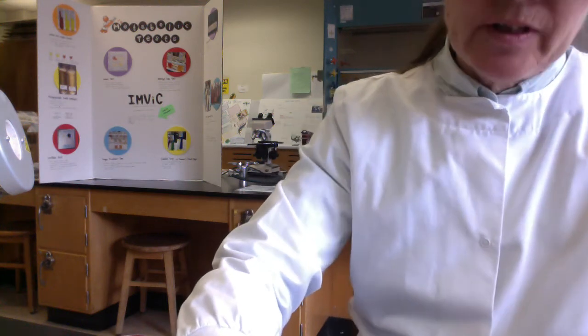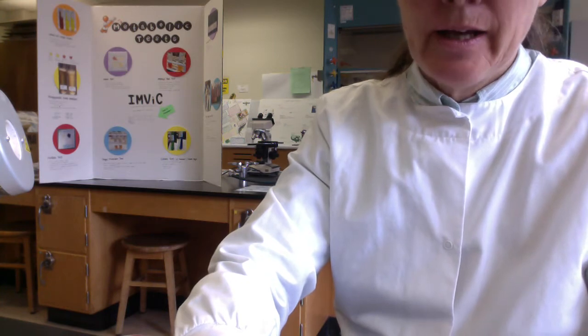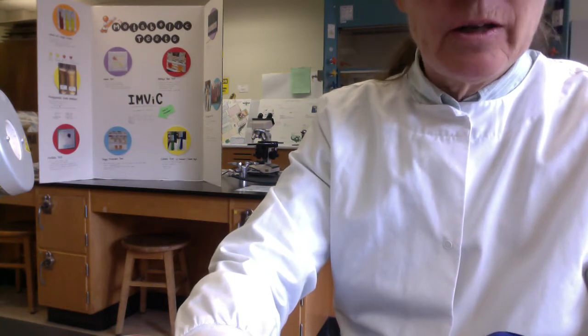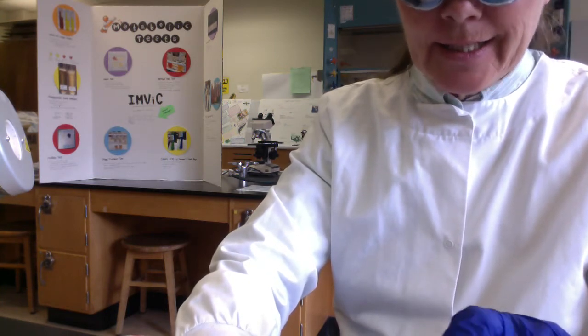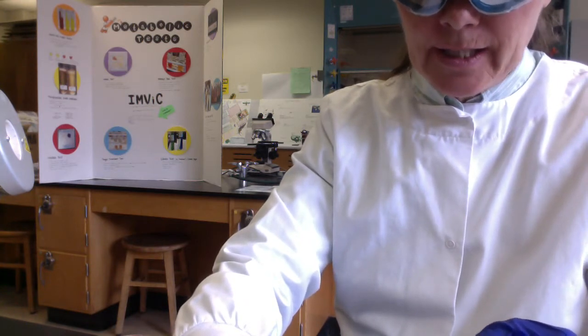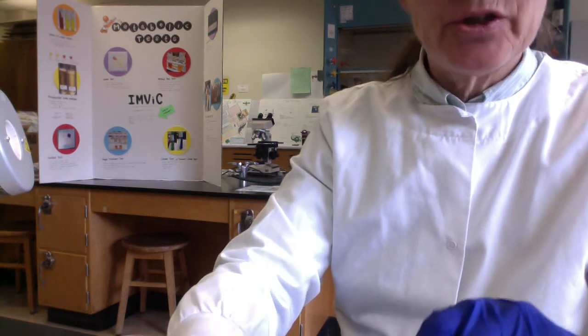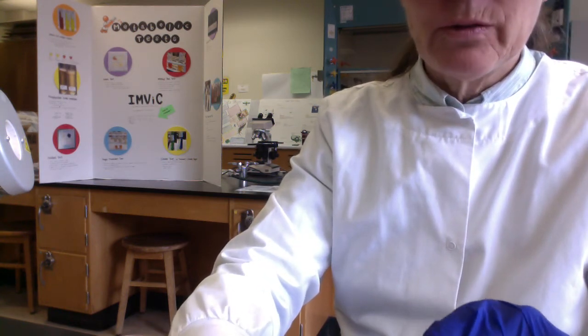Hi, micro folks. This is a follow-up for Lab Manual Chapter 10. These are our blood agar results. And again, my setup here, folks, it's going to make it really hard to see the hemolysis, but what I'll do, I'll just show you the plates and then we'll do a follow-up PowerPoint which will have some nice images.